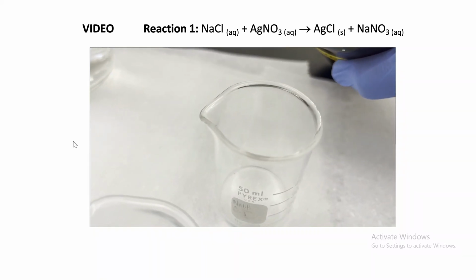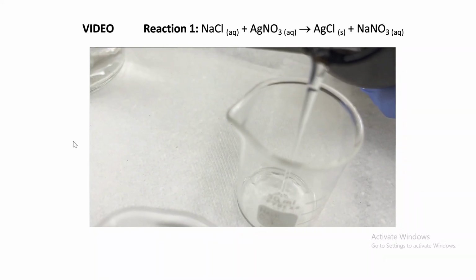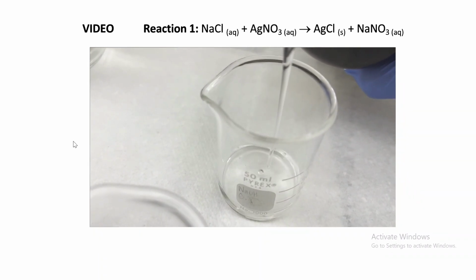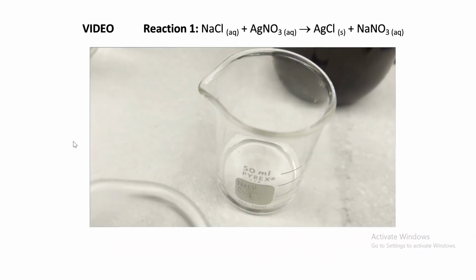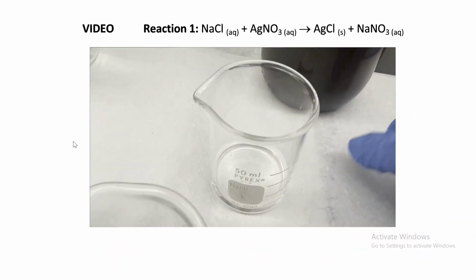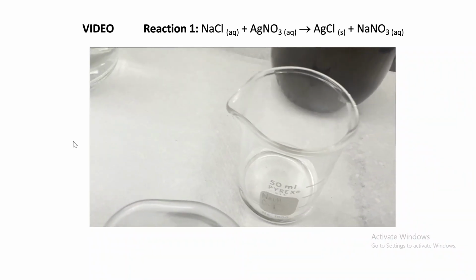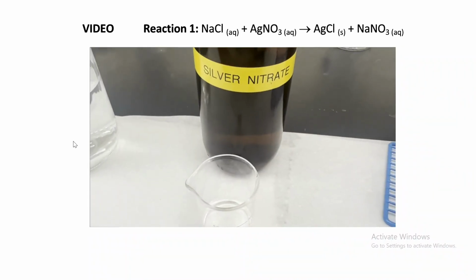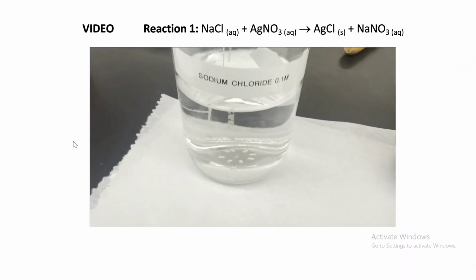And notice the color of the bottle where silver nitrate is in. It's in a dark bottle. And notice we pour it. Silver nitrate is a clear and colorless liquid. Just if you look at it, you might think it's water, but it is not water. All right, so you see a colorless liquid, silver nitrate, and it's in a dark bottle.